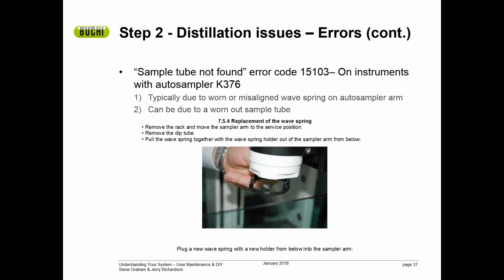For those of you that have the K375 and using it with the Autosampler, the K376, you may also find a sample tube not found error. Now, this isn't on the distillation system. This is on the Autosampler system. On the Autosampler, that's a very typical issue to find if the wave spring has been misaligned or worn out on the sample tube arm.